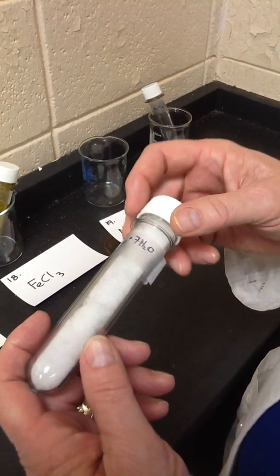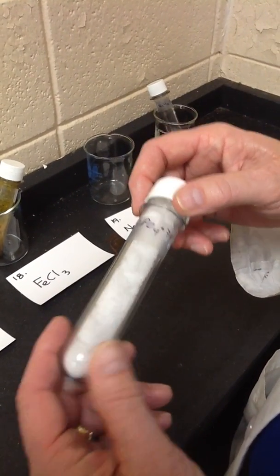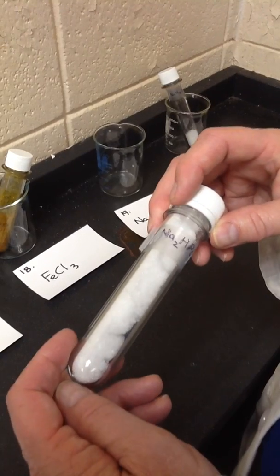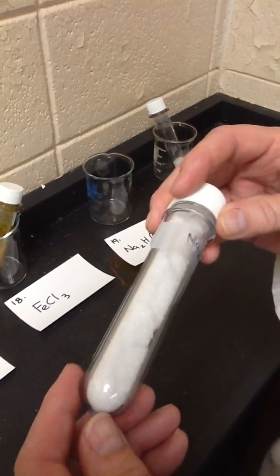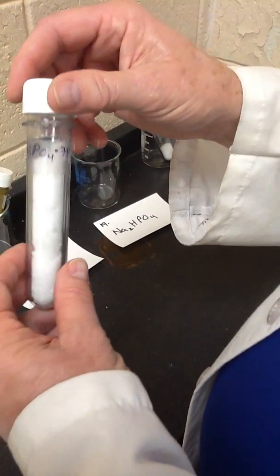Just getting ahead, some compounds have associated with them bound water in distinct molar ratios. I didn't mention it earlier, but our magnesium sulfate is much the same thing. I think it might be a heptahydrate. Maybe it's a pentahydrate. I'm trying to remember what the hydration state of regular Epsom salt magnesium sulfate is.